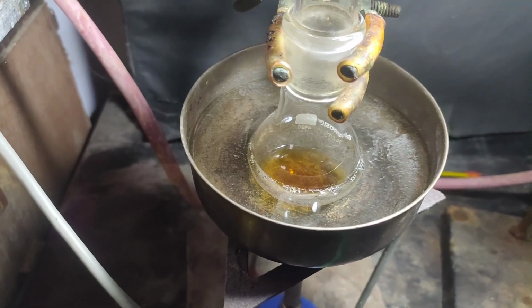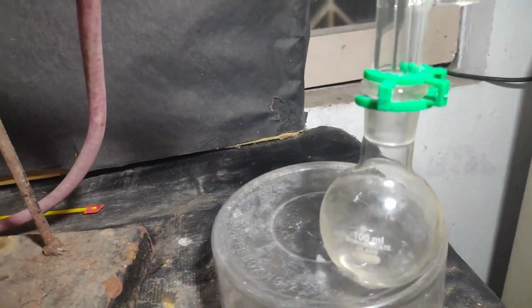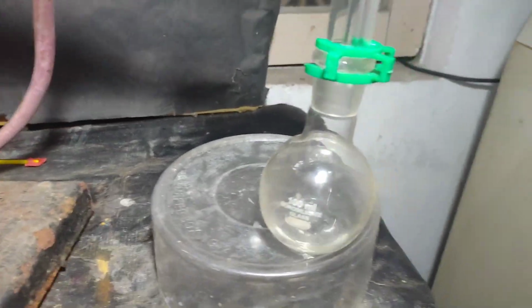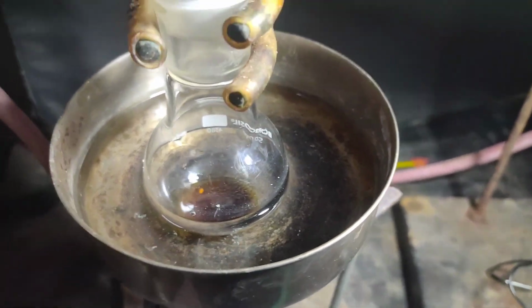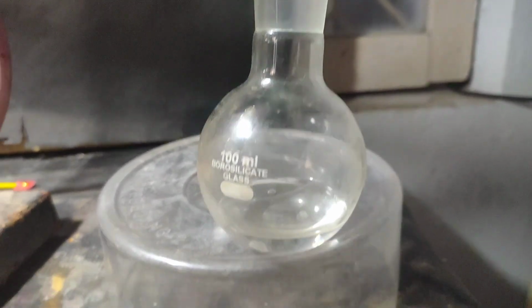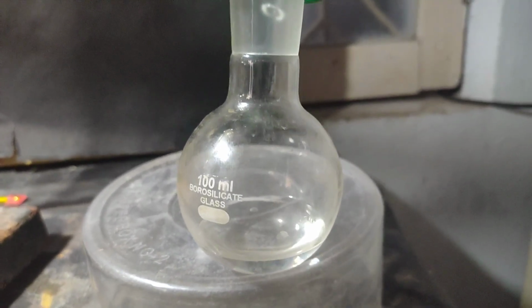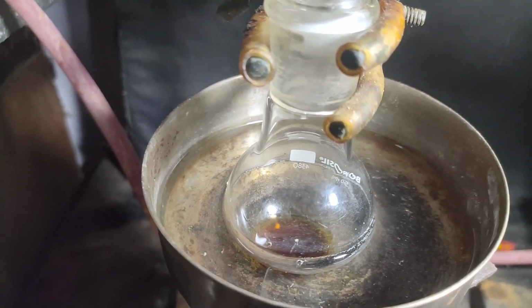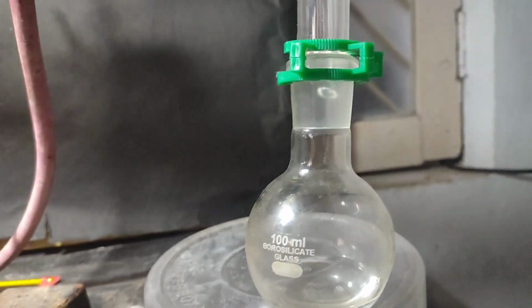As the water warmed up, the petroleum ether started to distill off. It distilled off very quickly, but at one point it slowed down. Even when the water started to boil, it wasn't distilling over. I stopped the distillation as heating leads to destruction of isocyanides. If I had my vacuum pump working, I would have distilled off at a lower temperature.